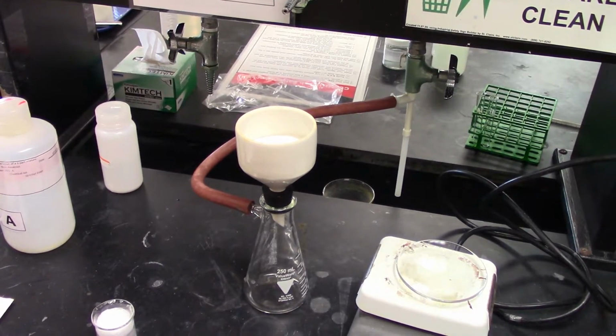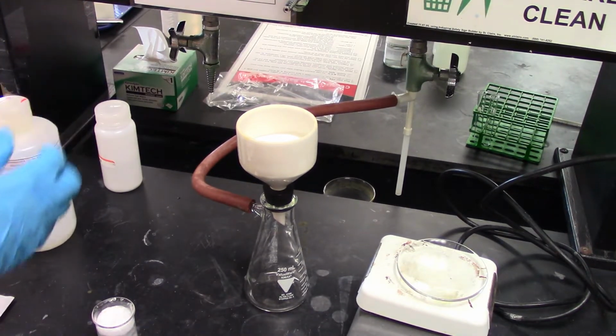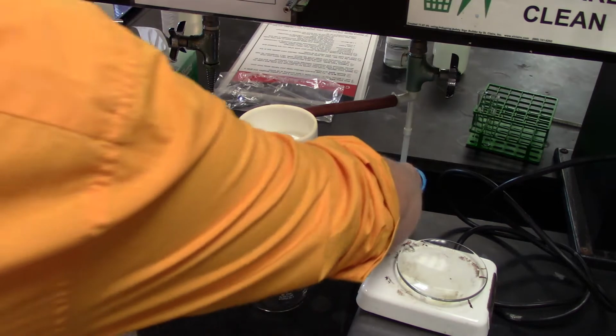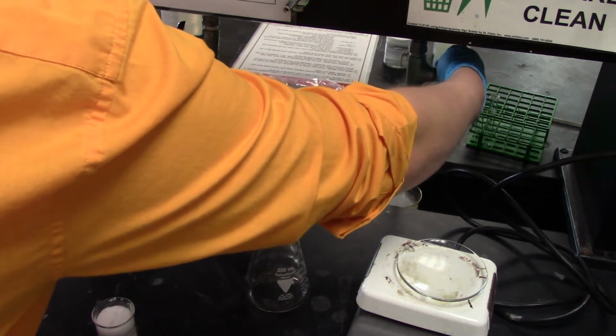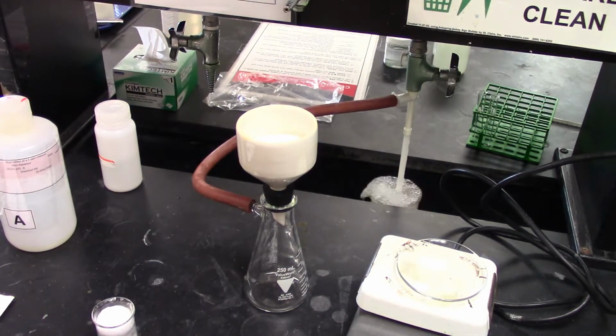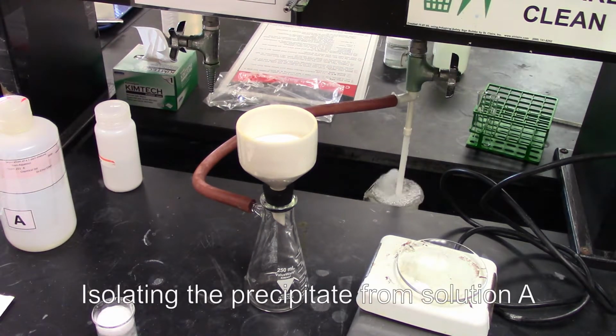Alright, so now we're ready to use vacuum filtration. So to do vacuum filtration, we're going to turn the water aspirator on full power. Now we use water aspiration, it's a nice cheap source of vacuum for us. There are better ways of doing it, but you know, can't beat water, right?